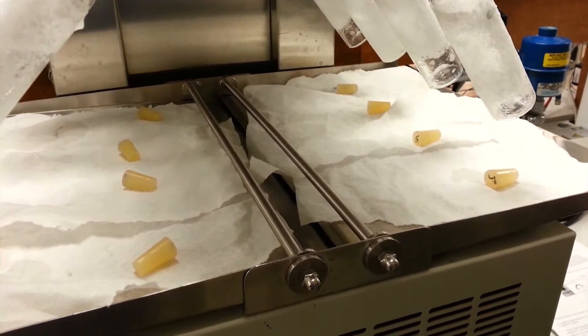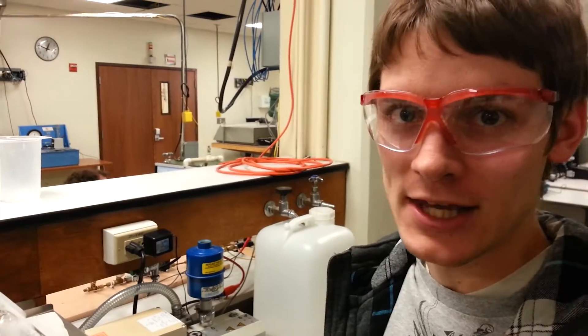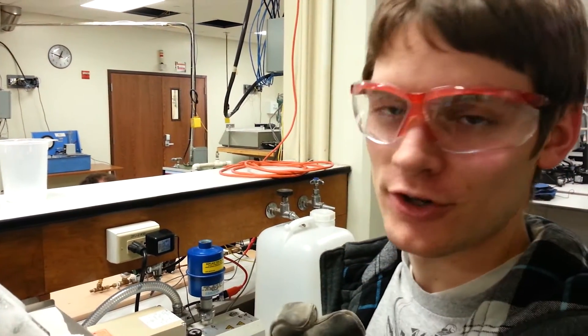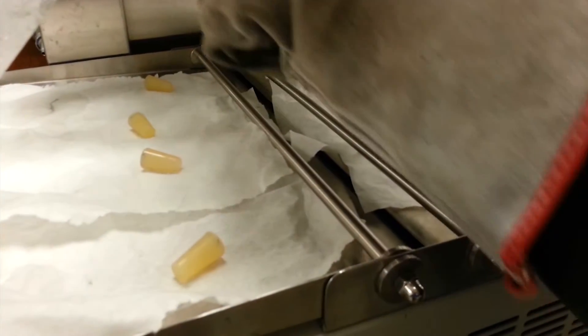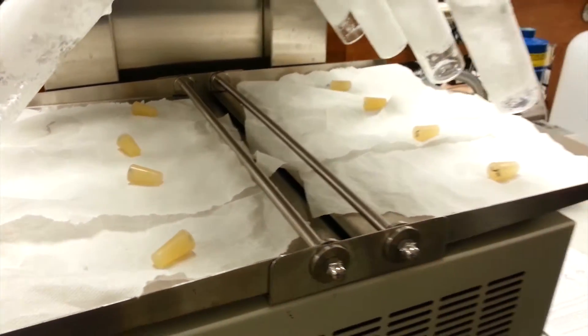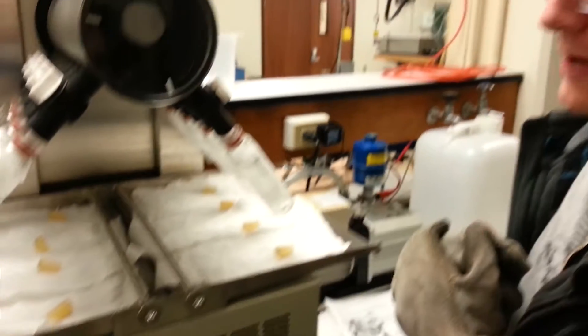Okay, so some things you want to make sure you're doing is you want to measure each of your samples with the same stoppers. So what we've got going here is I just lined each stopper up with each of its vials that we measure with.